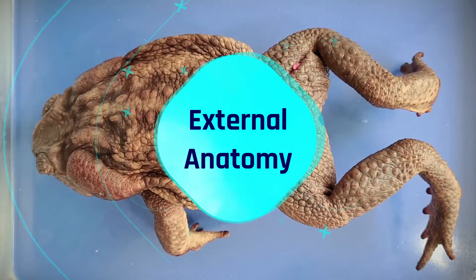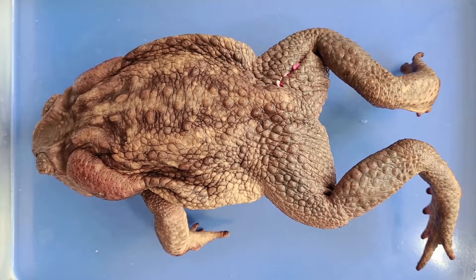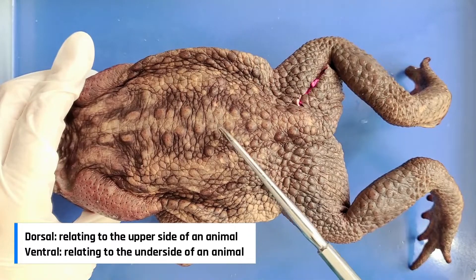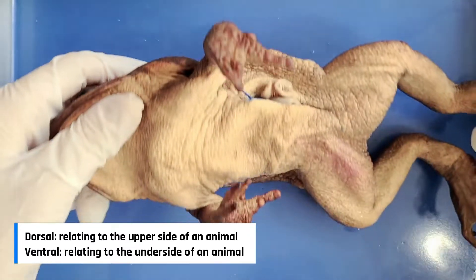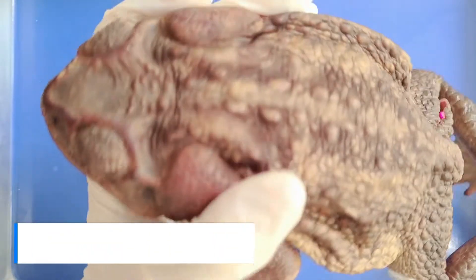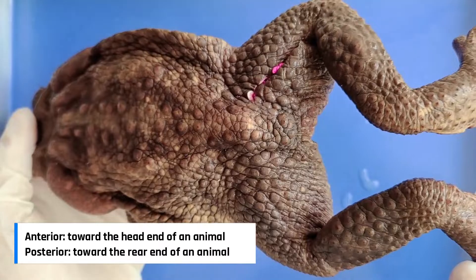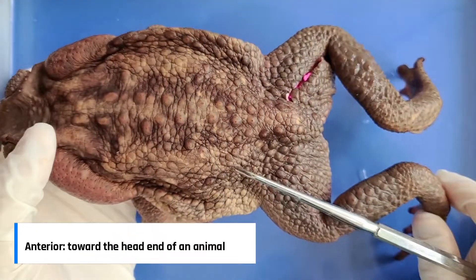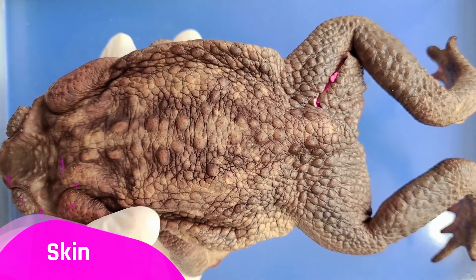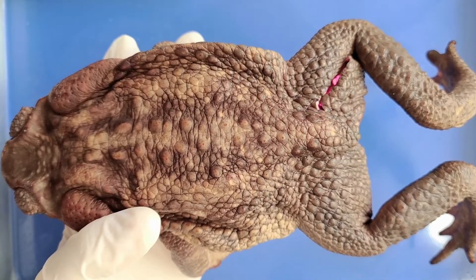Let's take a look at the external anatomy. First, let's get the toad oriented. Here is the dorsal side, or the back, and this is the ventral side, or the belly. Here's the anterior side, or the front, and the posterior side, or the back.